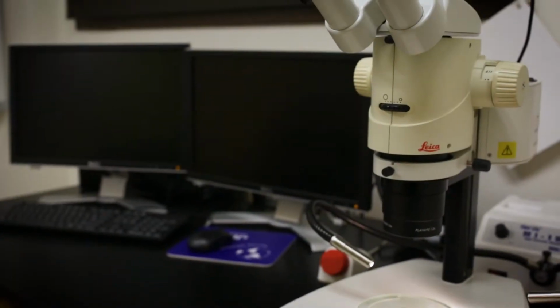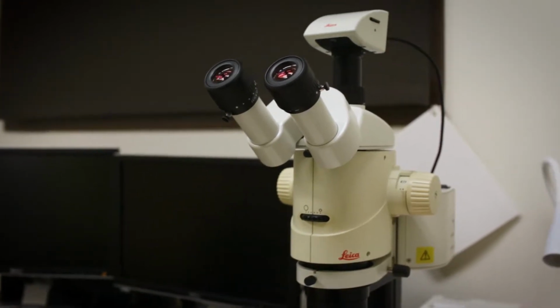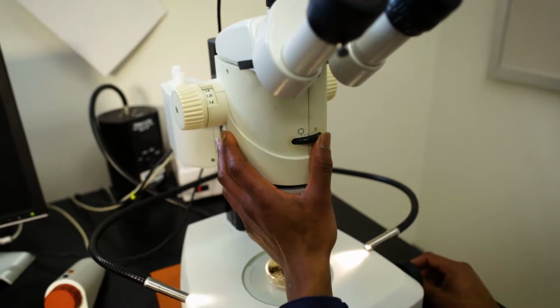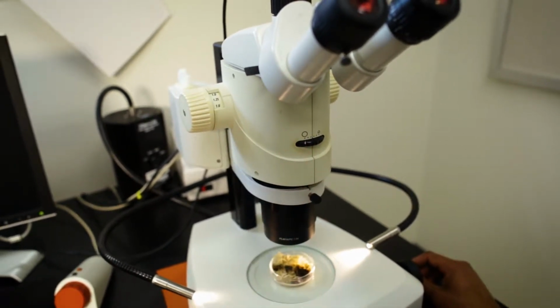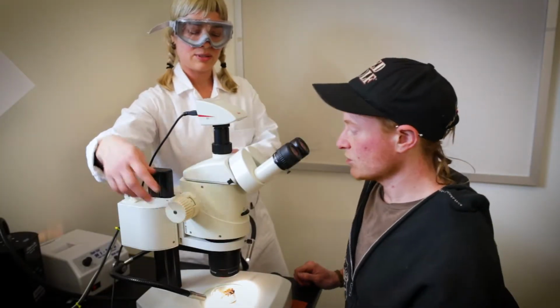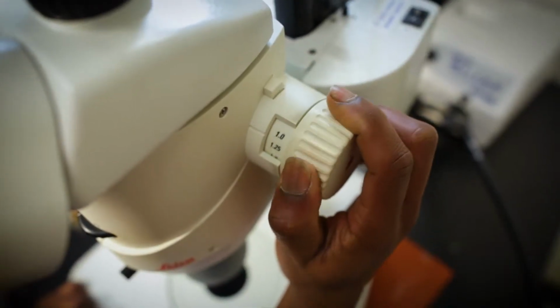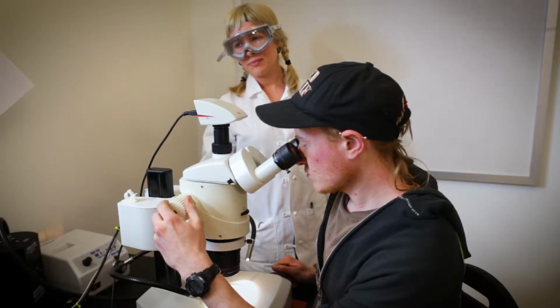On the front of the microscope, beneath the oculars, is a wheel which adjusts the opening of the iris. To maximize the resolution of your image, be sure the iris is fully open by turning the wheel all the way to the left. To the left and the right of the eyepieces, there are knobs that control the level of magnification. Adjust the magnification as you see fit while looking through the oculars.